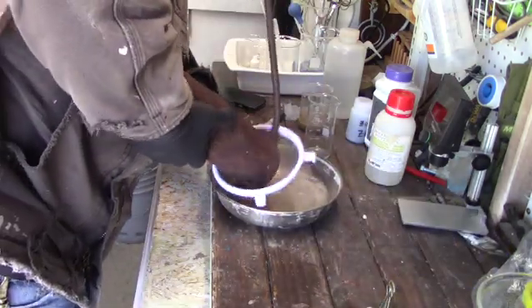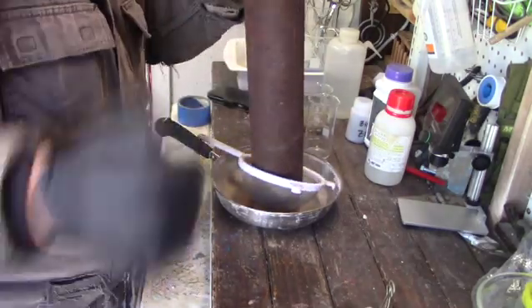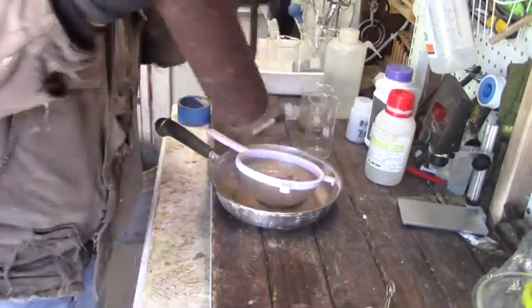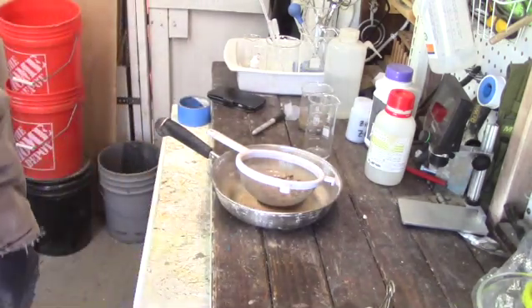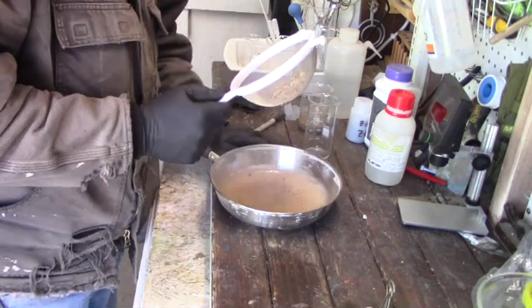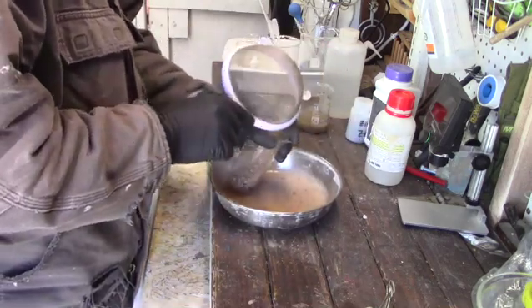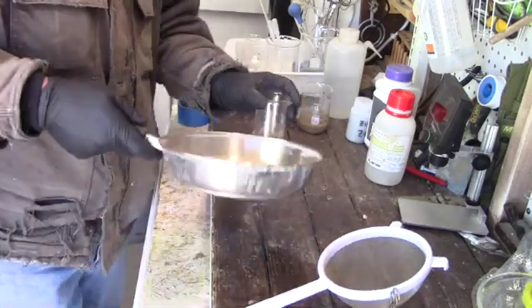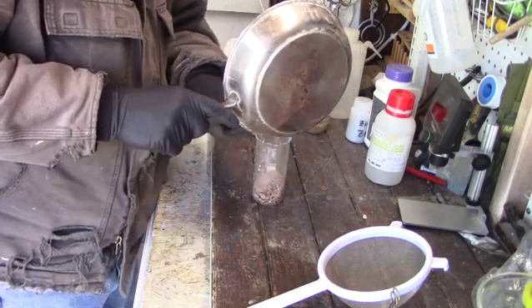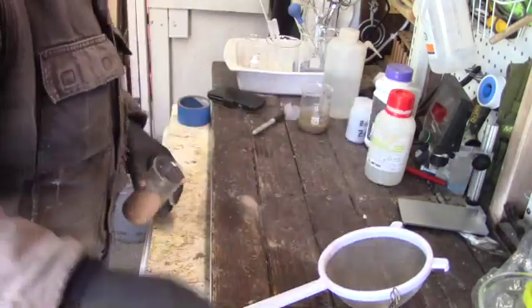Here's our second sample all crushed up, and it wants to stick in the tube. So I just use my handy crowbar and bang it a few times — that's how I fix most of my electronic equipment up here too. If it doesn't work after three bangs, it's not worth fixing. Checking for nuggets — nothing there, of course. And we'll just put this material in another beaker. I did mark these beakers A, B, and C coinciding with the sample letters on the buckets, so we should be able to keep track of it.